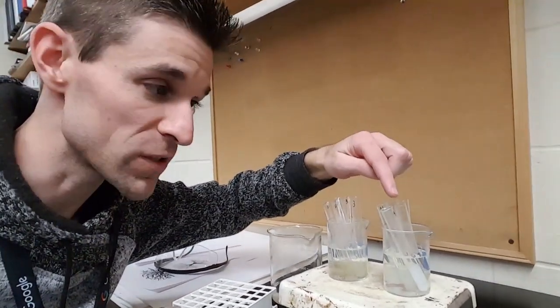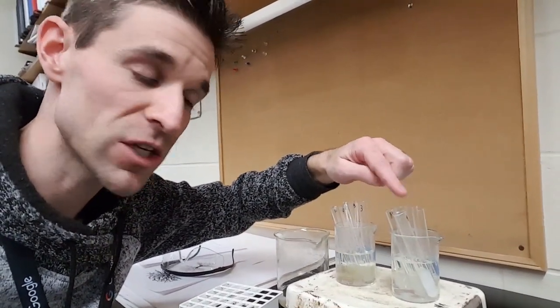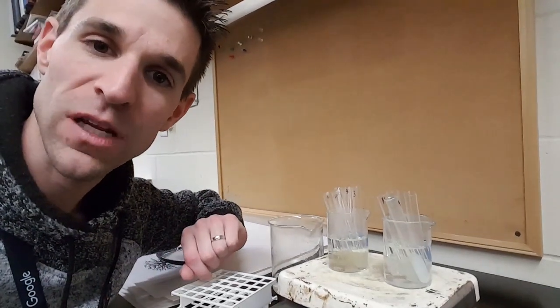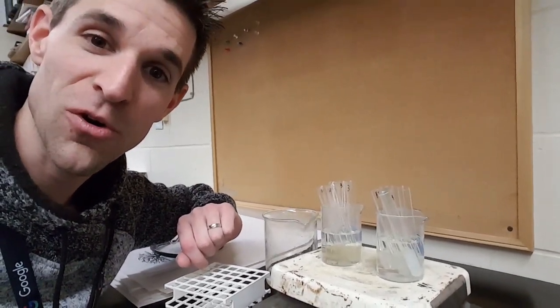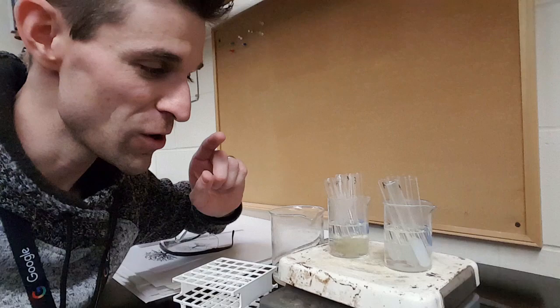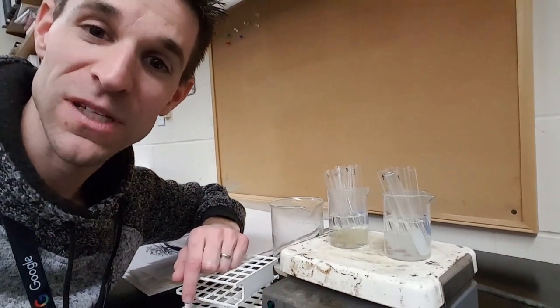And so again, here's our control. This is the water. We should really see no change here after boiling. And these ones, after boiling for 10 minutes, should be a dark color. So I'm going to pause video. We're going to let these go for 10 minutes, and then we'll see how it turns out.